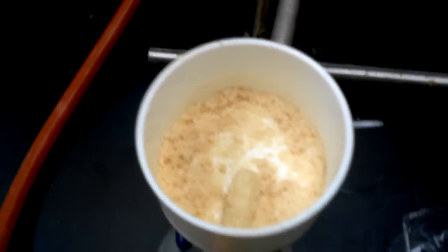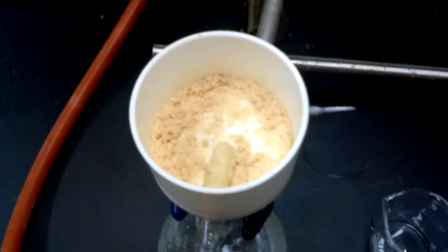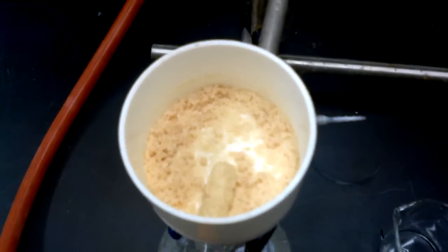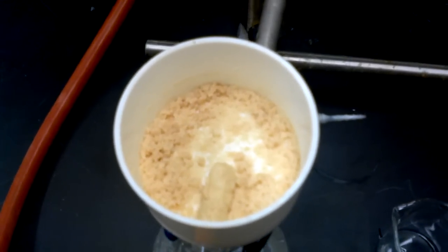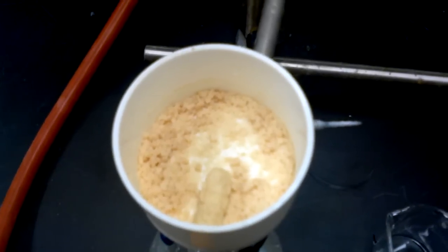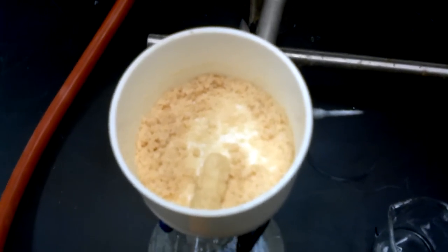So that's what the product looks like at this stage on the funnel. Now it's a solid. We started with the liquid, now we have a solid. So this is our first sign of success. Well done.